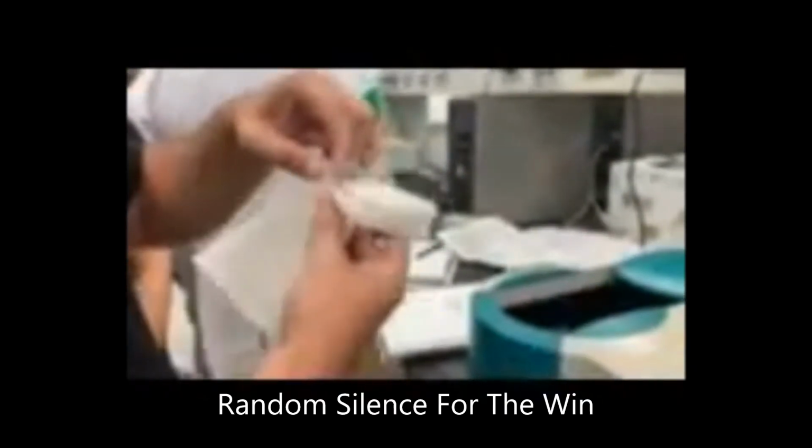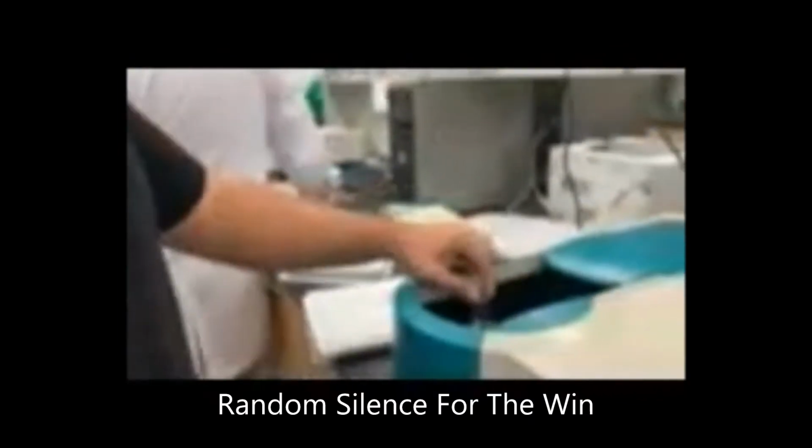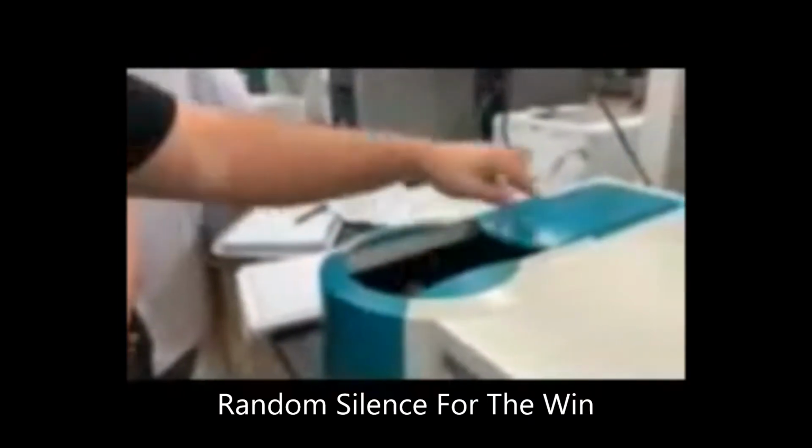After we have determined the wavelength that we should scan at, which is 600 nanometers, we begin to scan all of our dilutions. As you see, he is placing the dilution in the spectrophotometer, and he will run scan and record the absorption value that is shown on the screen.